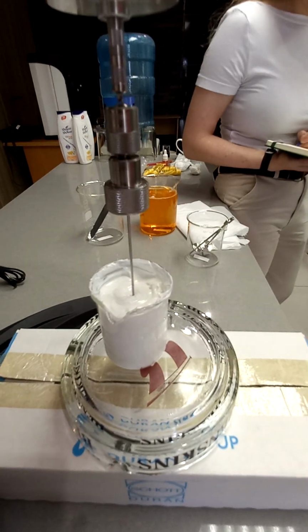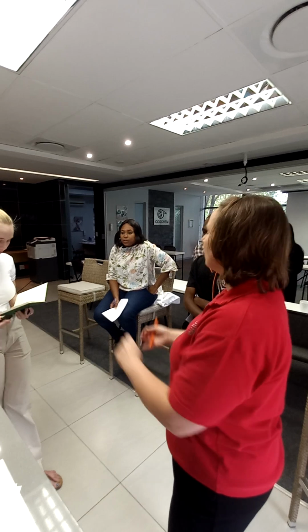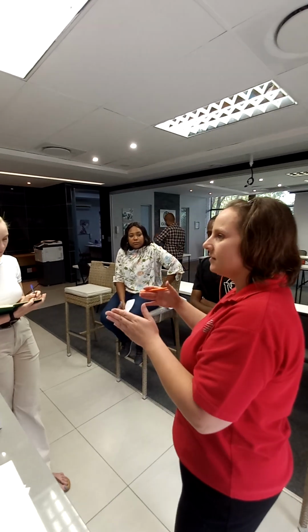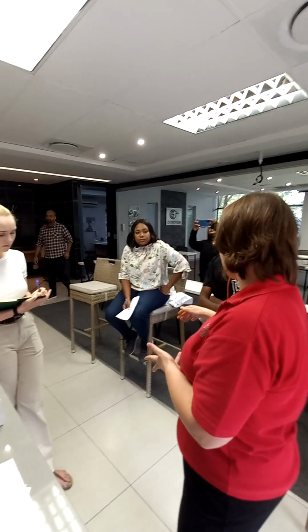Can I ask you a question? Yes. I used to work in QC, right? So we used to work with feed. Where did you work? The type of non-Newtonian behavior is what we call time-dependent samples. So you can have the same spindle, the same speed, but as your test runs, viscosity drops. So over time, viscosity drops.